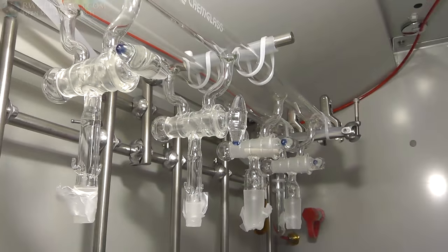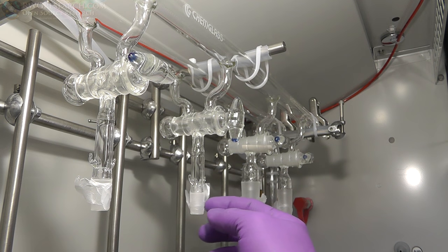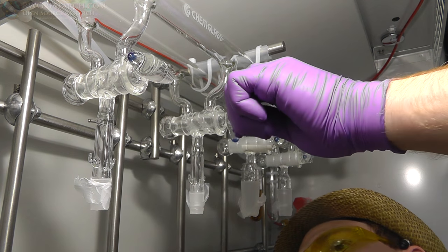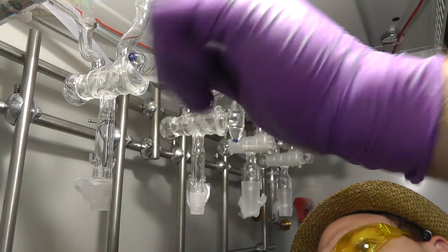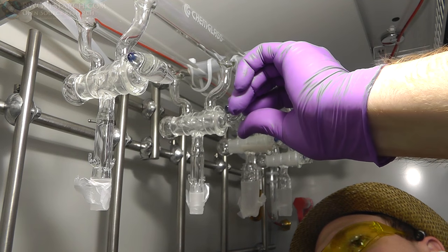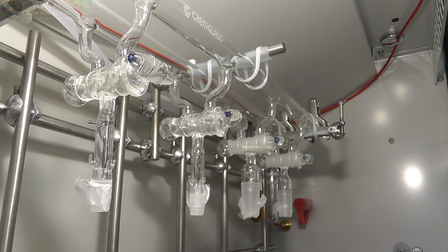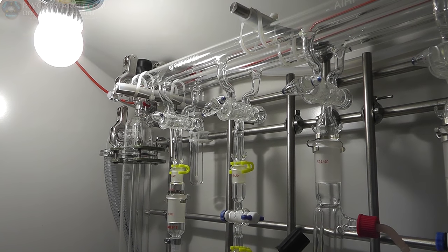The exact same thing happens for these fittings. You put a little bit of this vacuum grease on here. So once we get all these in place, we'll actually test them, make sure they're sealed well, but pretty cool. Well, learn something new every day.